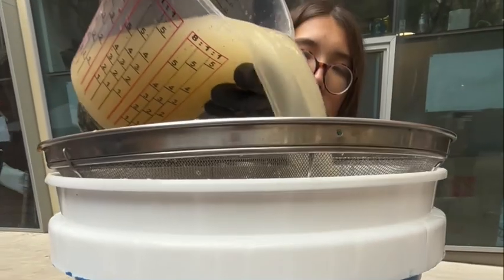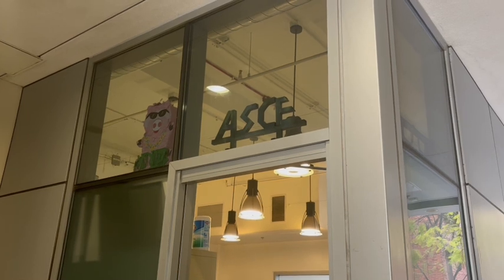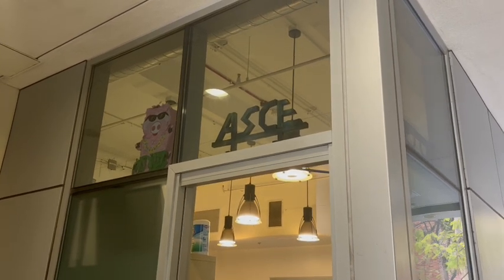To make that water drinkable, environmental engineers often use treatment systems such as the one ASCE's environmental design is using here. For this assignment, I'll be discussing and doing a live demonstration of the properties of one of the most powerful materials in water treatment, which is granulated activated carbon, or GAC. All right, let's get started on our demonstration on how GAC is used in water treatment.